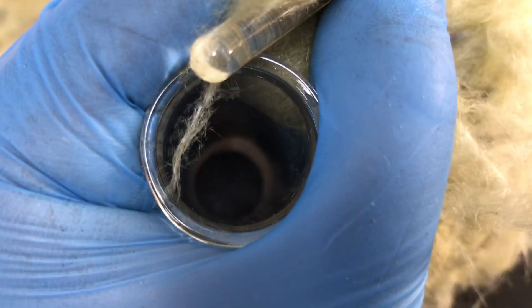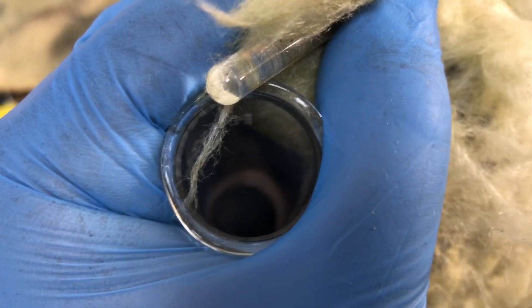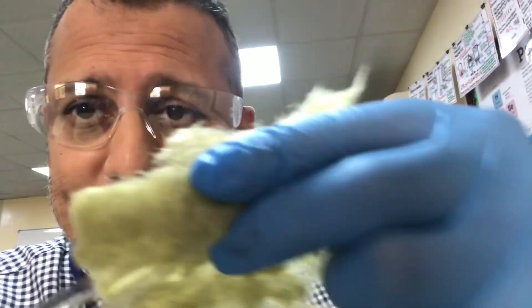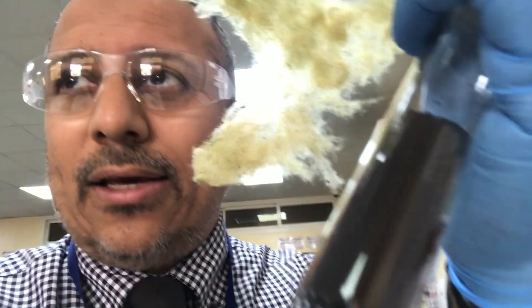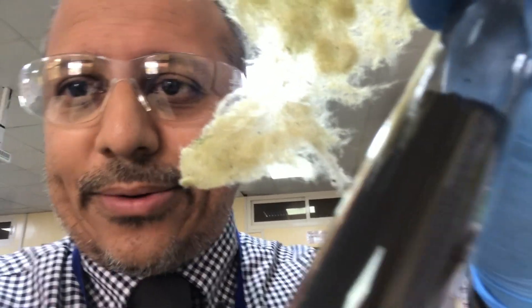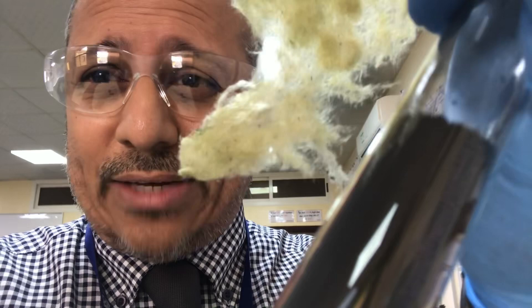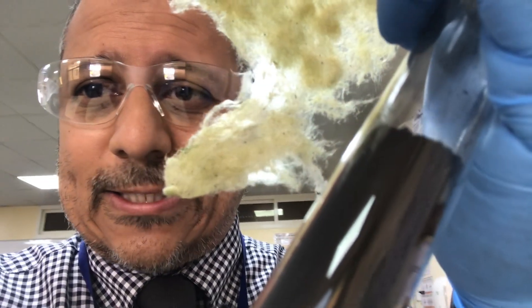What you don't want to do is you don't want to stuff it all the way in there because it will just create a plug and the pressure will build. What you've got to remember as well is that you are actually forming carbon dioxide in there so there is going to be a pressure build up. If it's completely sealed then the entire boiling tube is going to explode so you have to be very careful about this. If any doubt I would definitely recommend that you have a safety screen set up for your students if they are watching at a distance.